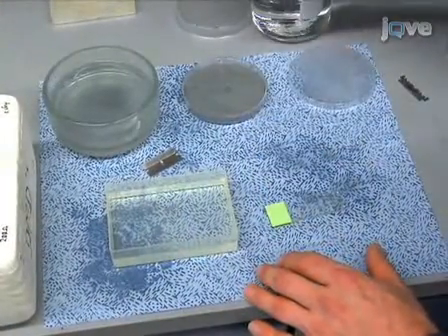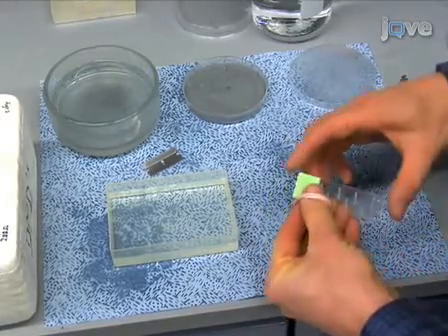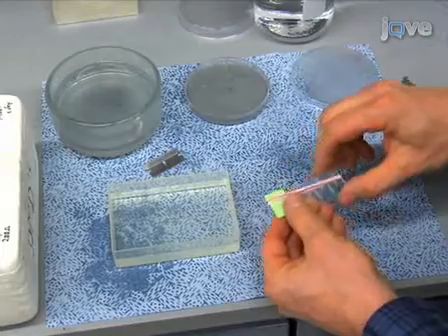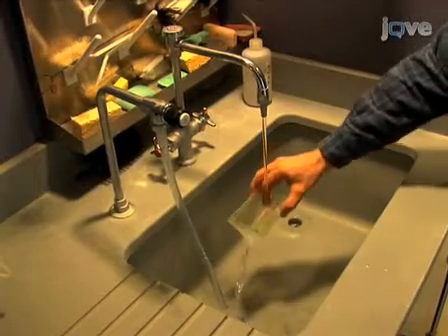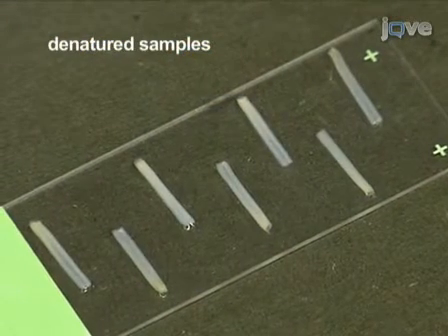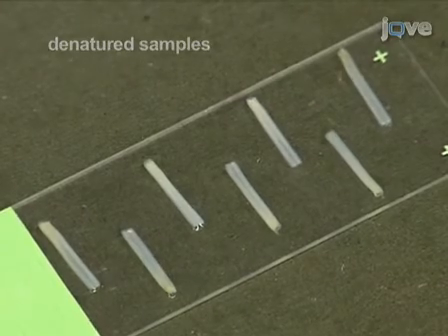Depending on the experiment, the hypocotyls may be inactivated with a brief heat treatment at this point. To do this, we bind the glass slides together with a pair of rubber bands, put the assembly in a container with 100 milliliters of deionized water at room temperature, and place it in a microwave oven at full power. With our microwave oven, the water starts to boil at about 50 seconds, and we stop the microwave 15 seconds after boiling begins. The hot water is quickly poured off and replaced with cold water to stop denaturation. Optimal heating will mean that samples will lack any responsiveness to low pH, while at the same time not become weak and break easily.